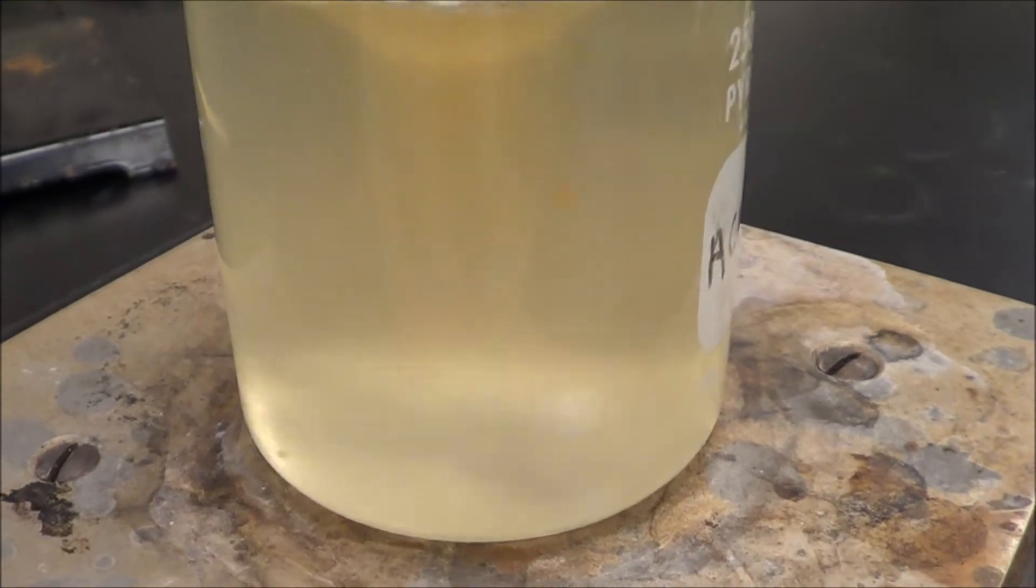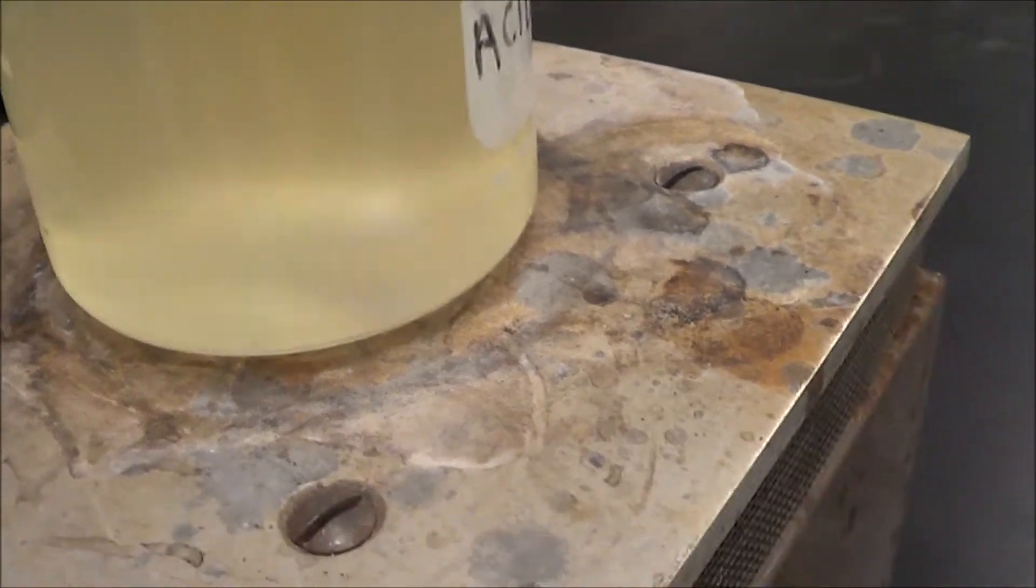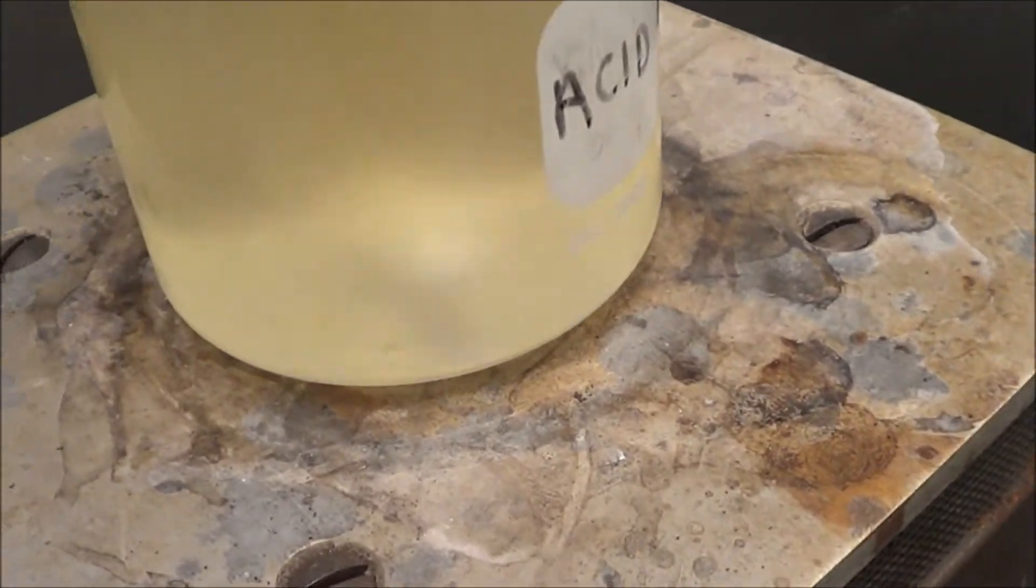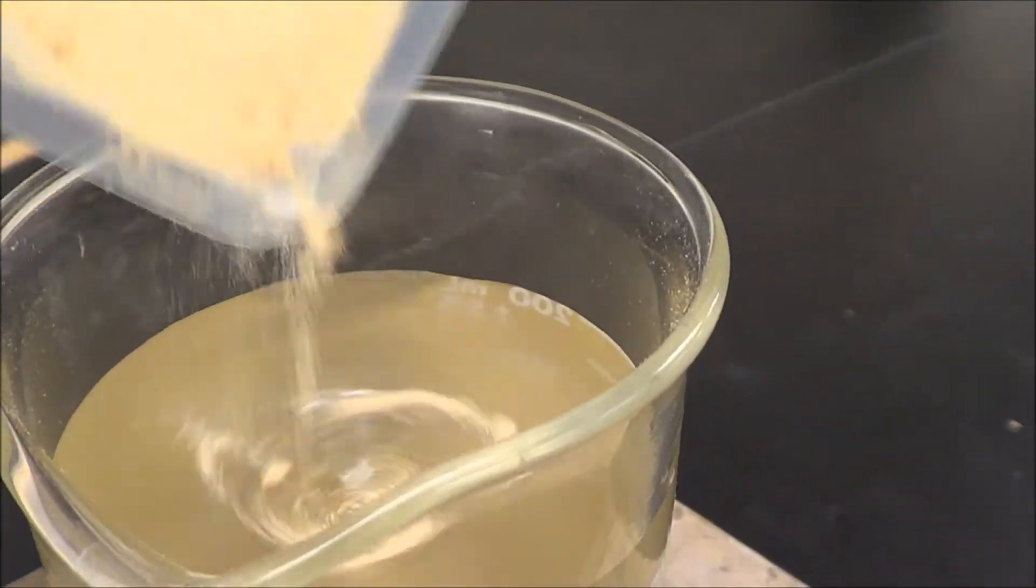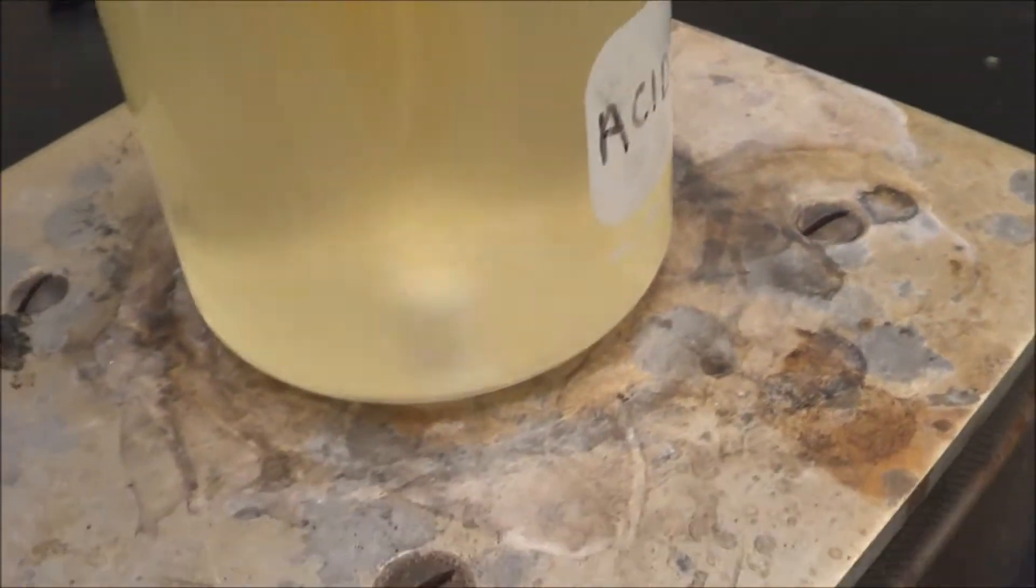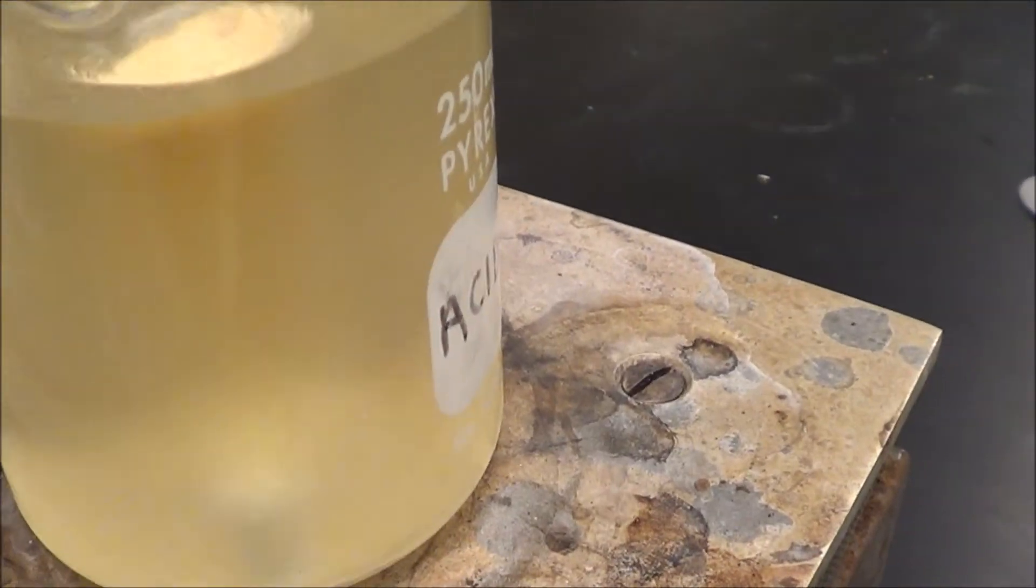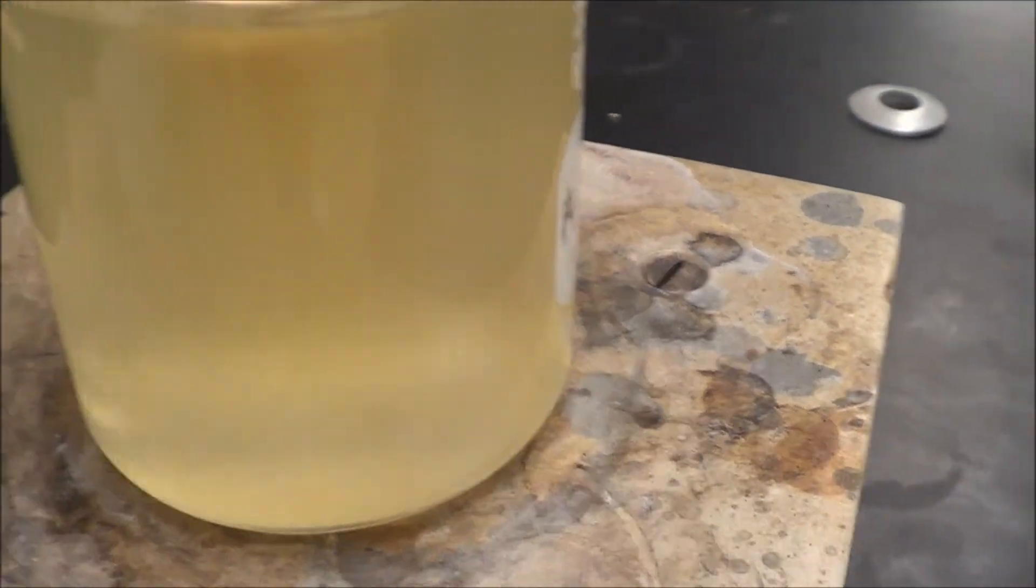And eventually we're going to have our agar. Now what this is doing here, it's stirring it and heating it at the same time. A little more. Now it's really starting to stir here.